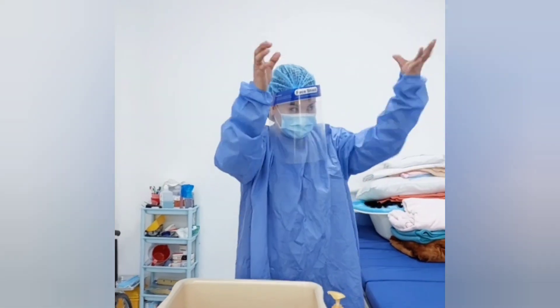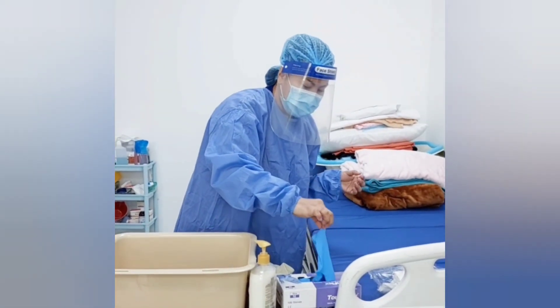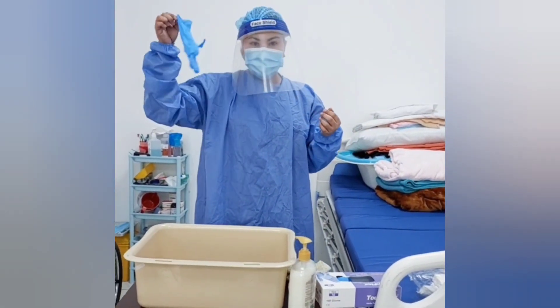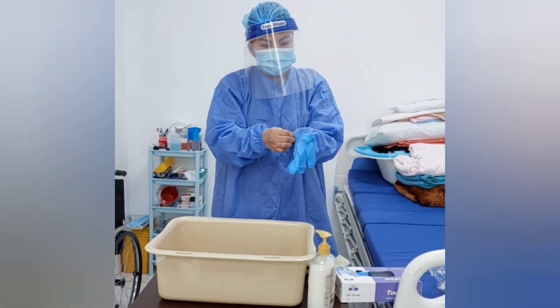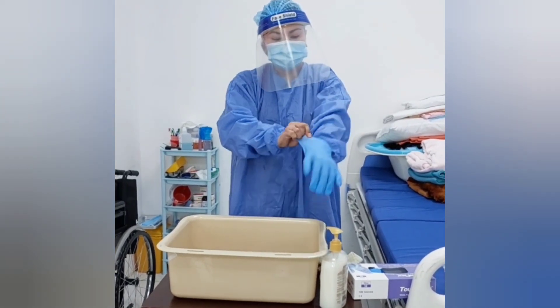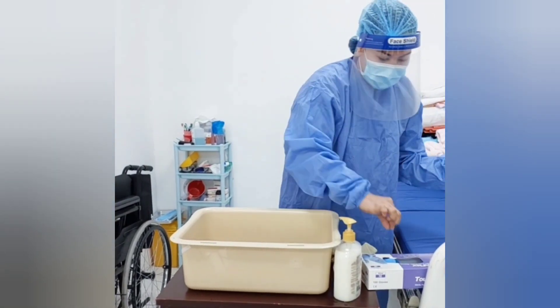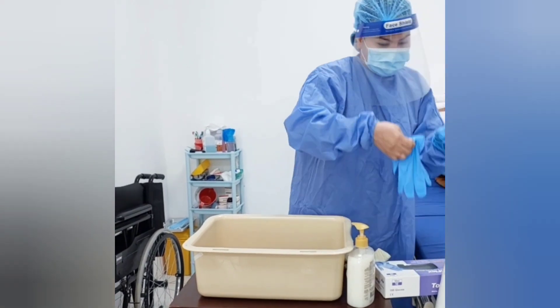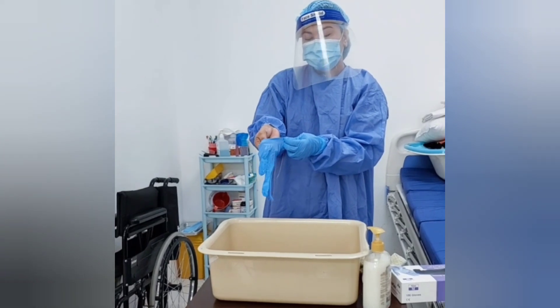Lastly, I will put on the glove. Take out the first glove from its original pack and touch only restricted surfaces corresponding to the wrist. Don the first glove. Make sure to cover the wrist of the gown inside the wrist of the glove. Take out the second glove with a bare hand and don the second glove, to avoid touching the skin of the forearm.